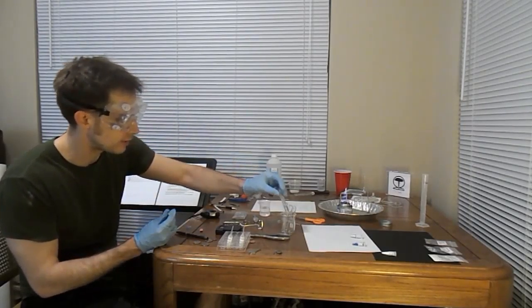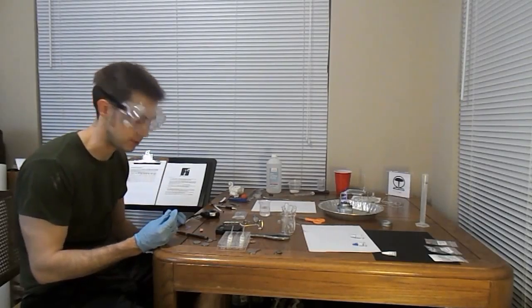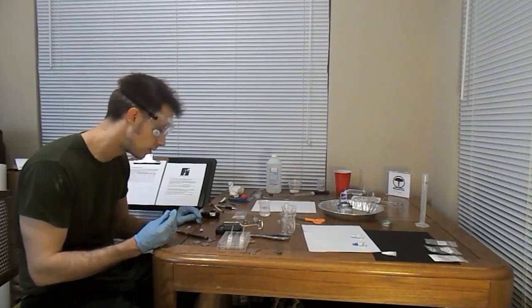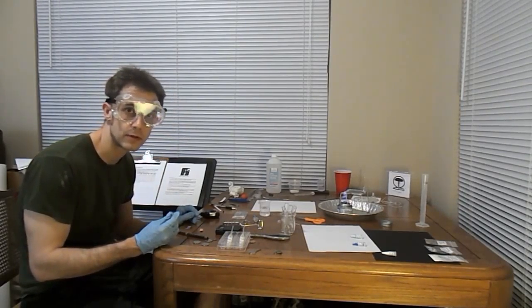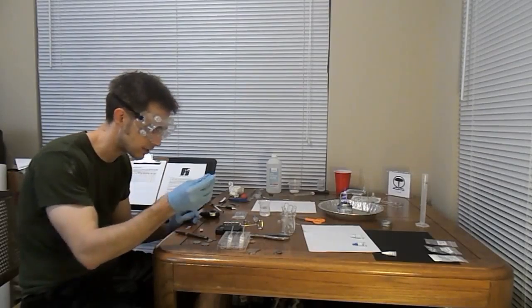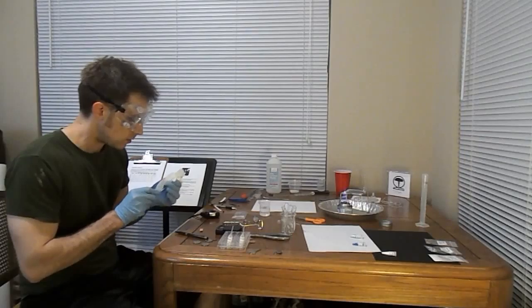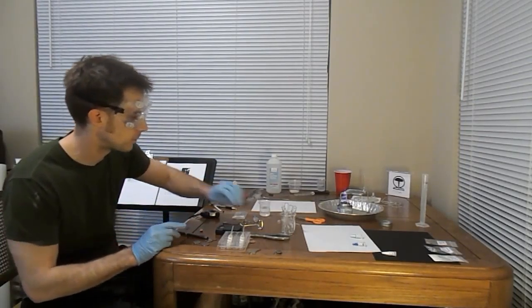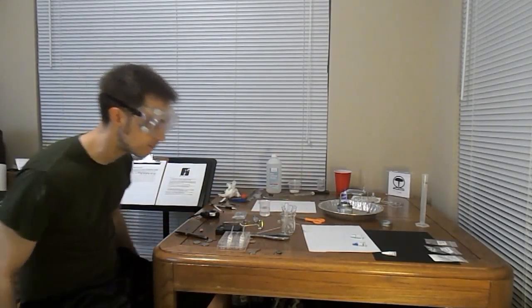Yeah, no real change on the litmus paper, and if I remember correctly, one of these measures acids, the other measures base, and water is basically neutral. So what I have is no evidence of reaction that produced a solution anyway. Well, no evidence of a reaction in that tube at all, actually. But yeah, so 6 more substances. We got this.